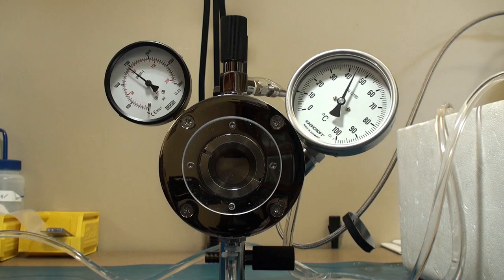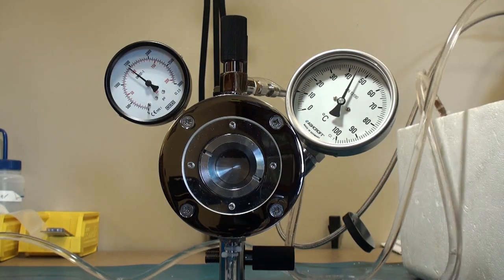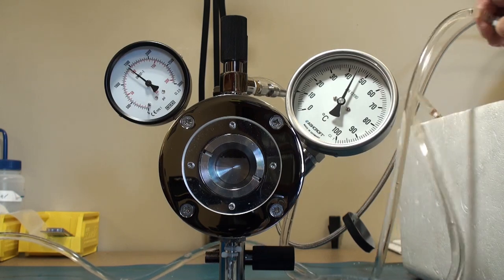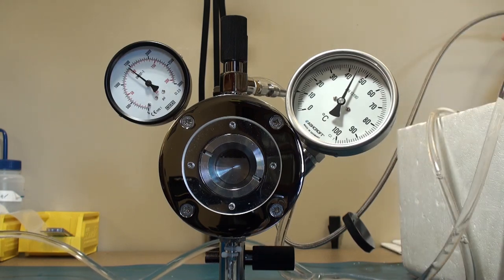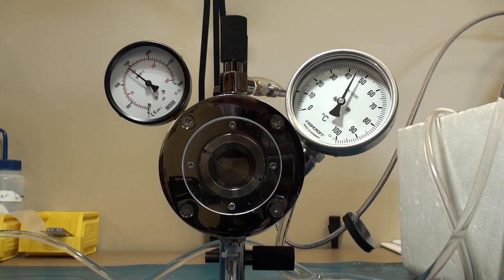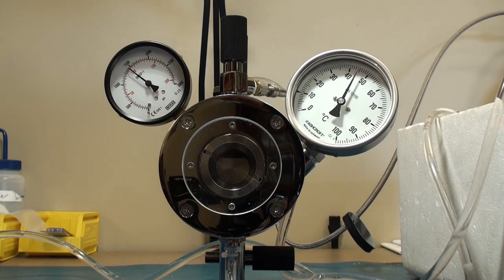Really the only thing to do is maintain the temperature and slowly bleed pressure at less than 100 PSI a minute. So if you're at 1500 PSI, you should take fifteen or twenty minutes to atmospheric pressure.